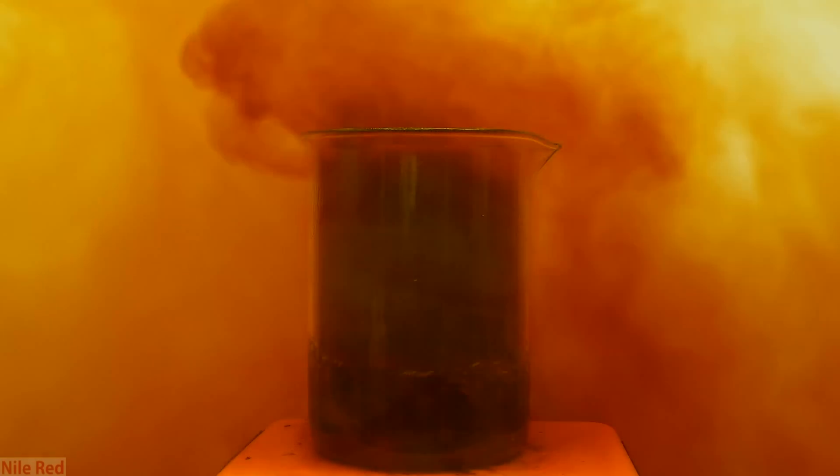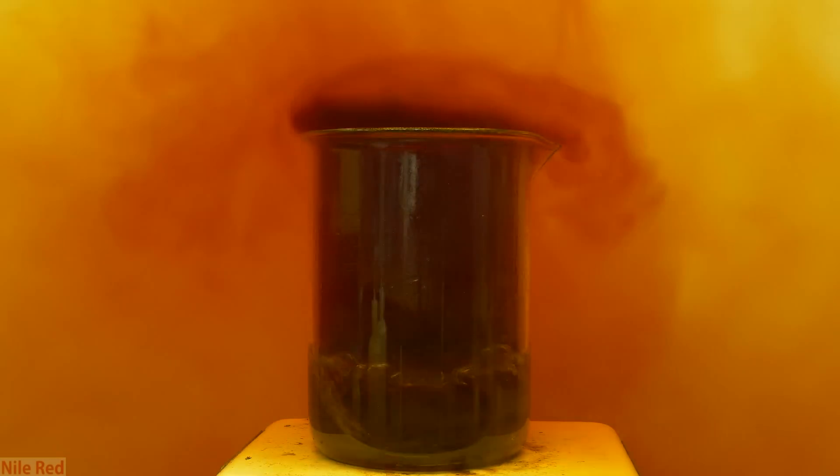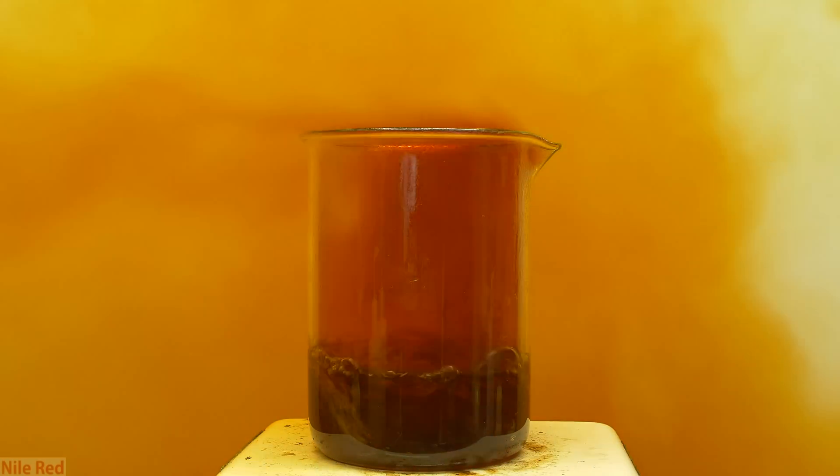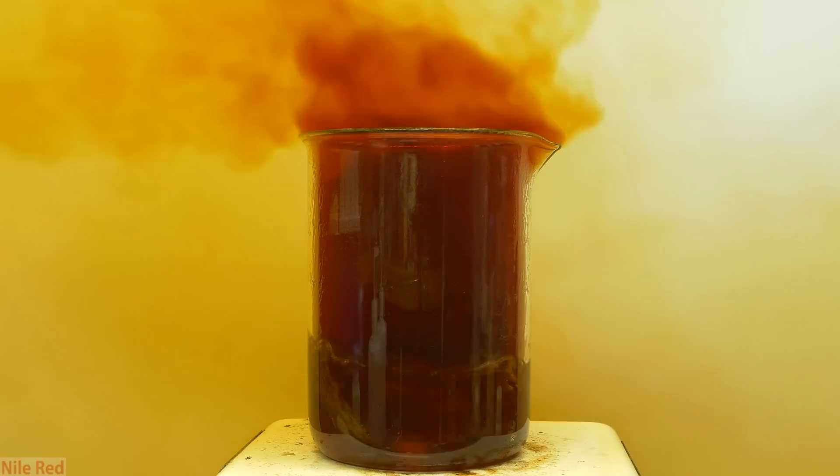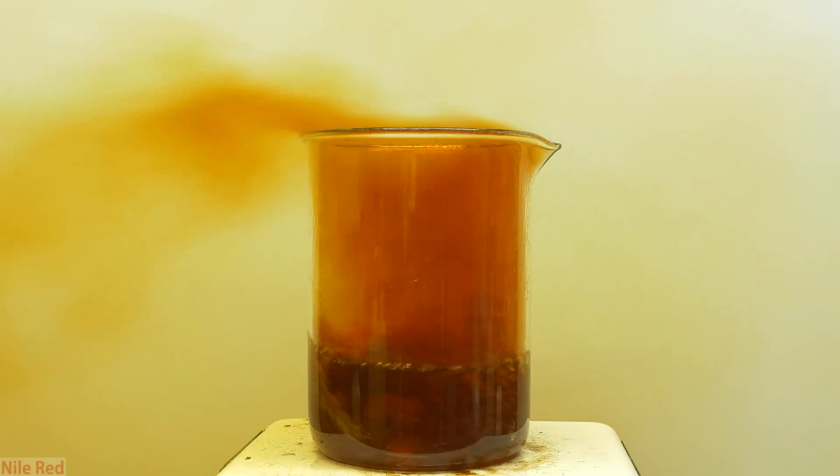If we were to leave the hot plate on, then the reaction might even go more out of control than it already is. As it's pretty obvious to see, this reaction produces a lot of dangerous nitrogen dioxide gas. So for this reason, this experiment must absolutely be done in a very well ventilated area.